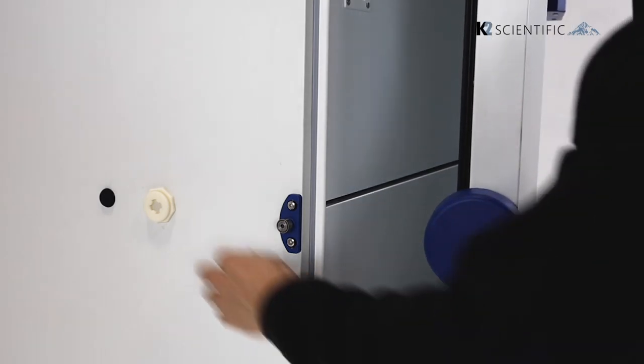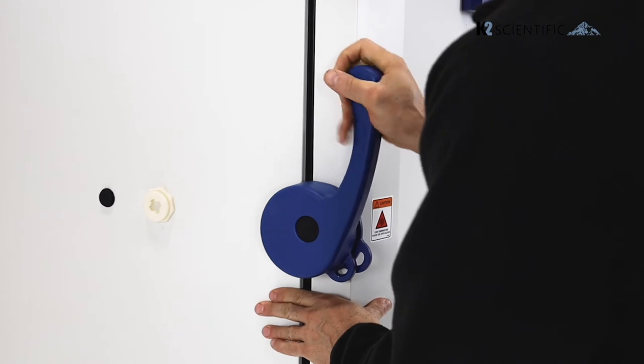Also, when you're closing the door, if the release valve is open, it makes it a little bit easier.